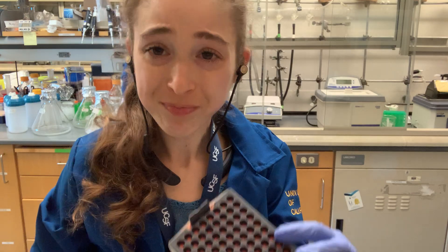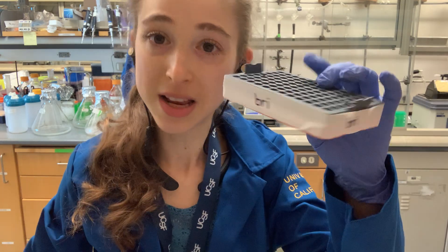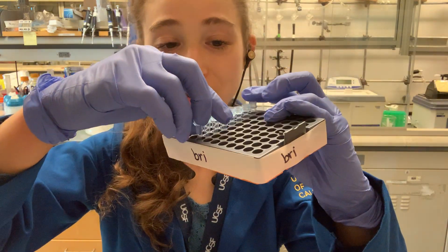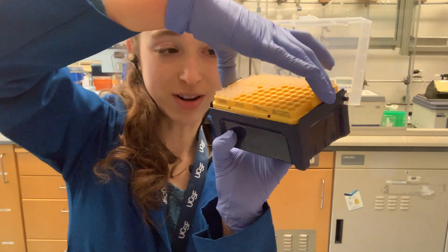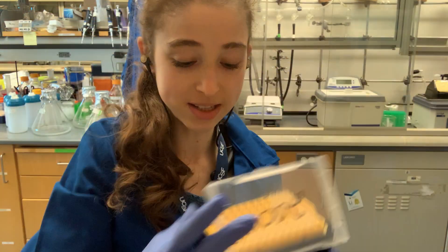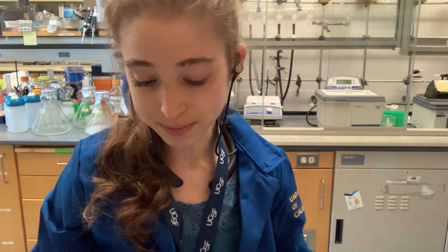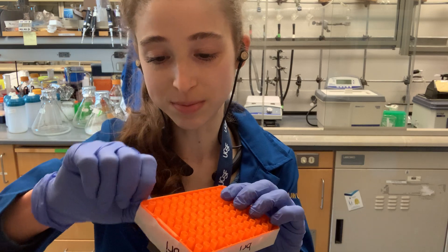Basically you can make a little free — well, free if you count the pipette tips — holder for your PCR strip tubes using these inserts that come out of your pipette tip racks. We get these tips in racks, refill the containers, and when we're done with the racks we can tape them together and make a PCR strip tube holder.